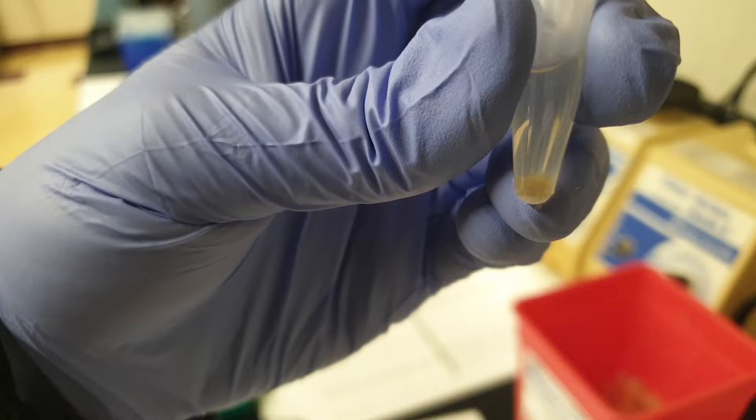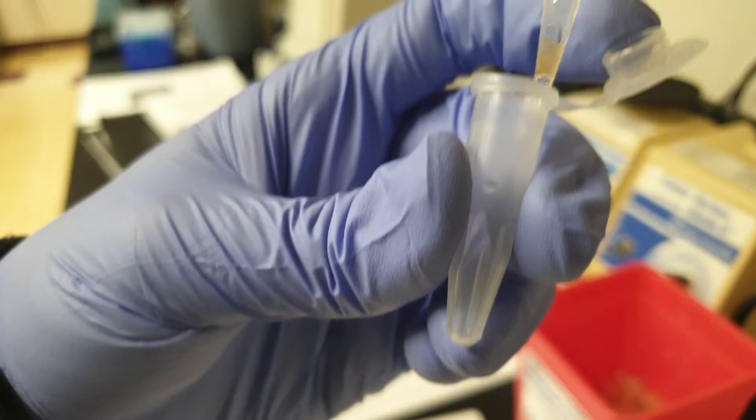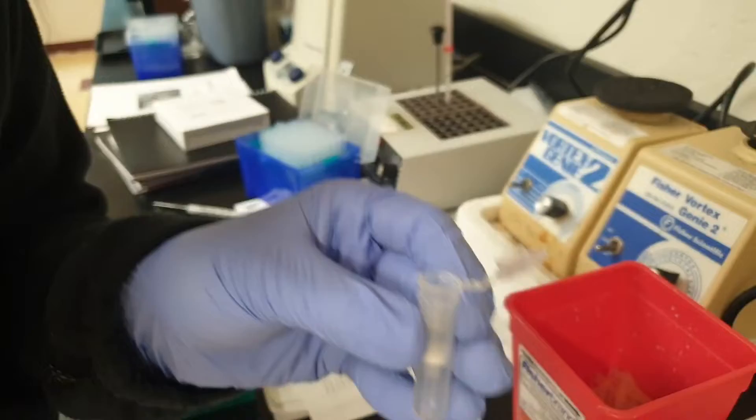There might be little chunks; try to get them as well. Be careful not to touch the white part, otherwise this is going to damage the spin column.